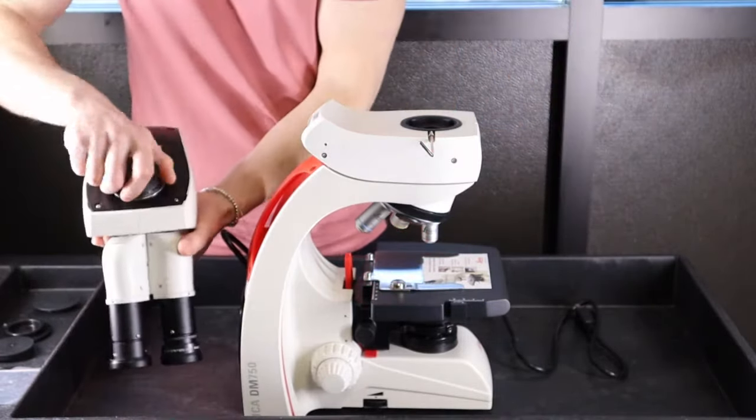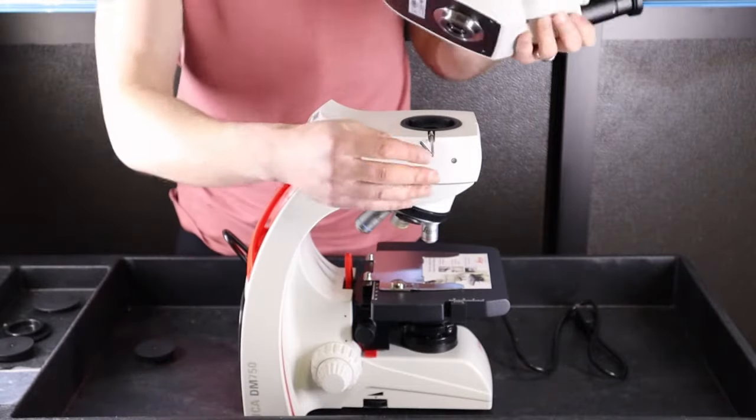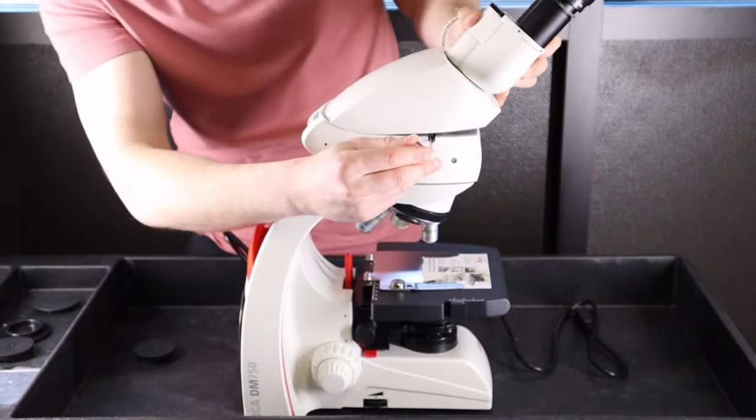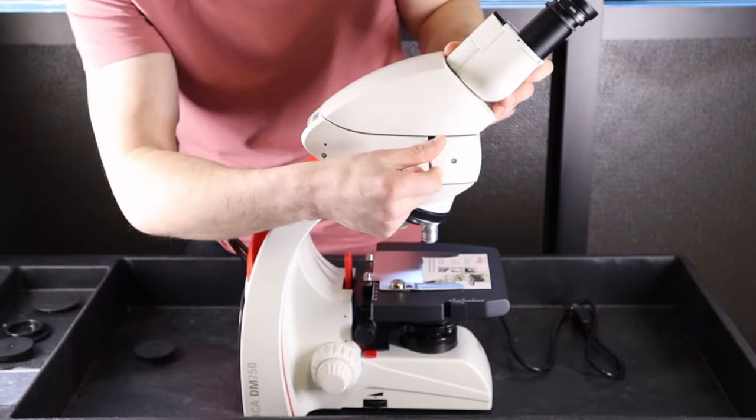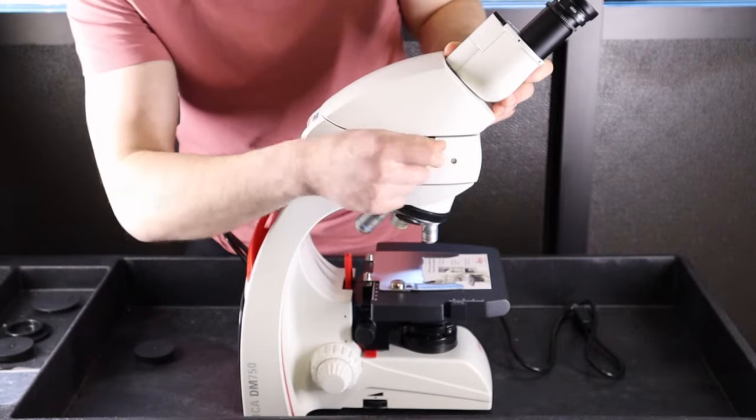Take your head, remove the black cap underneath, and tighten down while holding the head into position.